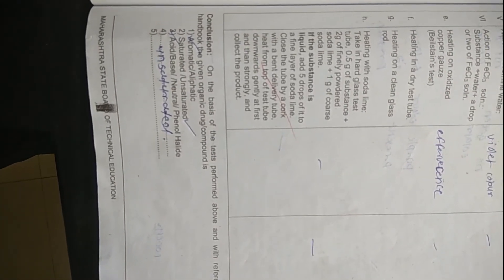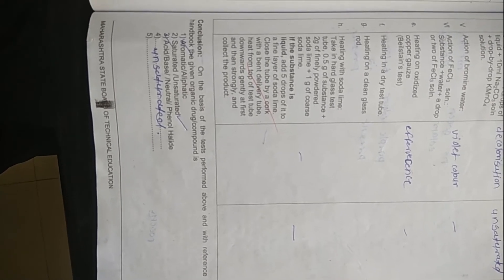Lastly, we conclude that based on the test performance and with reference to the handbook, the given organic drug compound is an aromatic compound — it is an unsaturated, acidic compound.